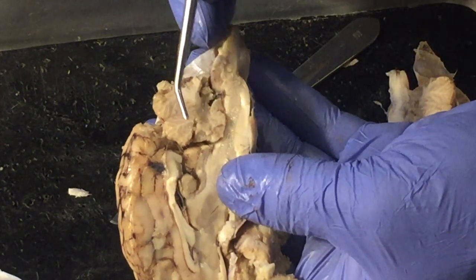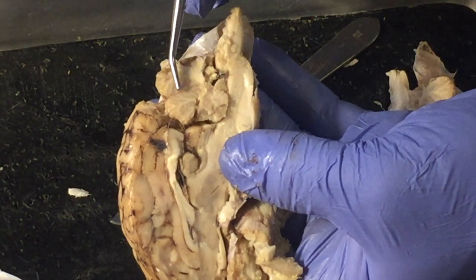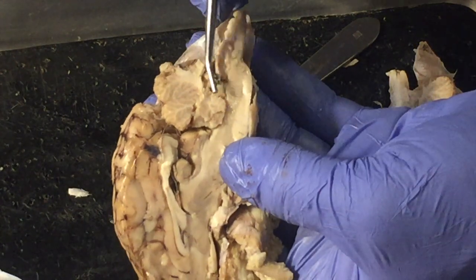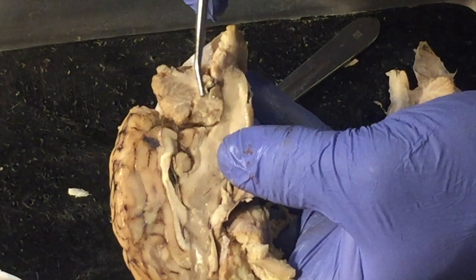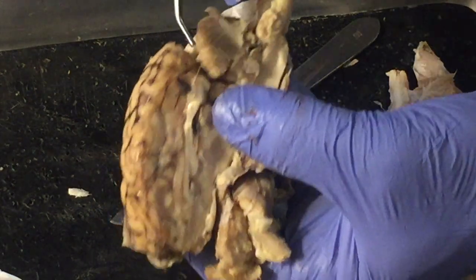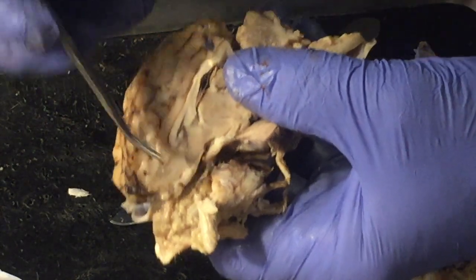The cerebellum is responsible mainly for coordination. If you've seen somebody that can walk a tightrope, the Wallendas or something, this is a part of the body that they've developed really well to allow them to do that. The cerebrum in humans, this is 4/5 of the brain, the cerebrum right here.